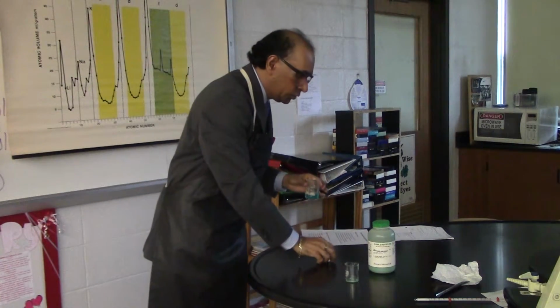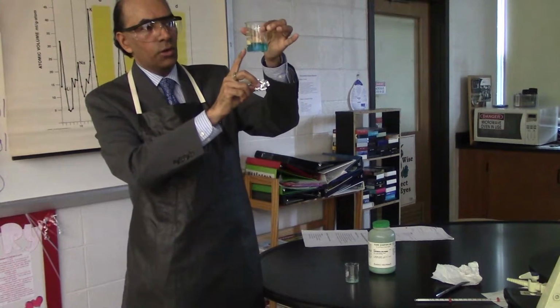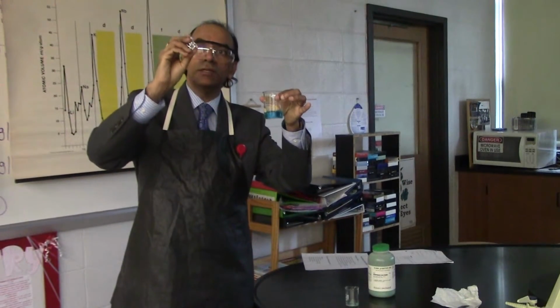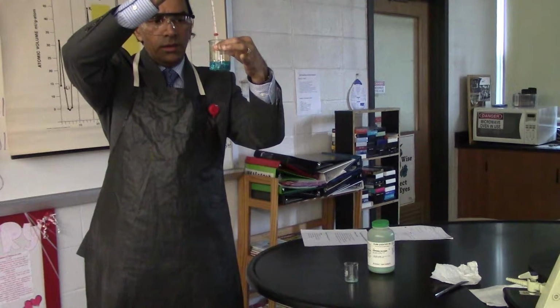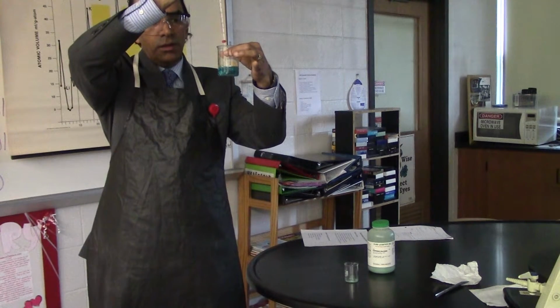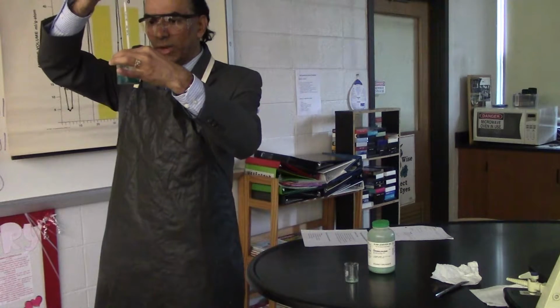And then finally, I'm going to go to my actual experiment, where I'm going to try to remove copper from that blue solution. This is now aqueous copper chloride solution. I'm going to use aluminum, which is higher in the metal activity series. I'll drop the aluminum over here, and I'll use my thermometer to poke it downwards, hold it down, and if you look very carefully, you might not be able to see it. Bubbles are forming, a brown substance is being produced, the temperature is actually going up at the moment. So a chemical reaction is taking place.